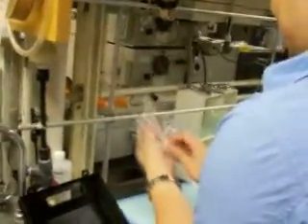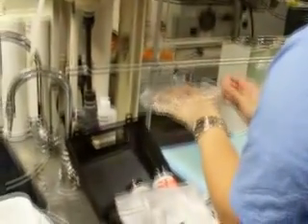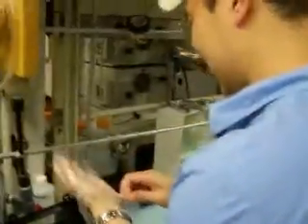Okay. Shall I go over to the spill and survey the scene over there? I will make one note that these disposable gloves seem to be the kind that people bring to basketball games as fans. They're unusually large. We have a foam finger. Do you feel that those provide added protection that your other gloves, which seem to be thicker, would not provide? I also am a little bit worried about the perforations and the holes. Perhaps you should use a regular glove inside of that glove. That's a good point. I will first allow my hands to dry.